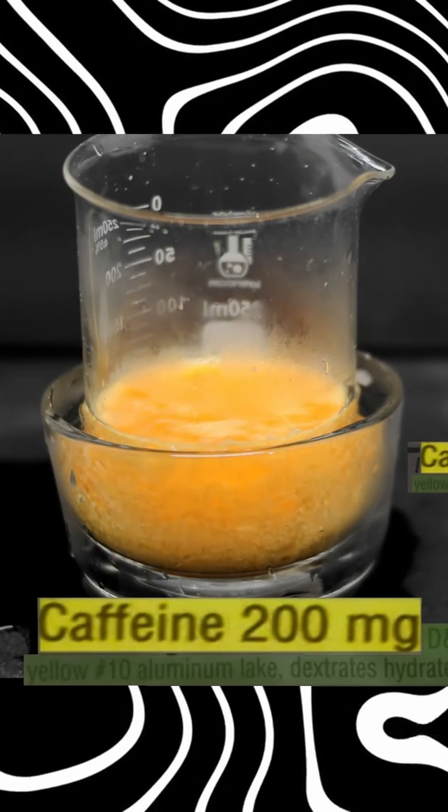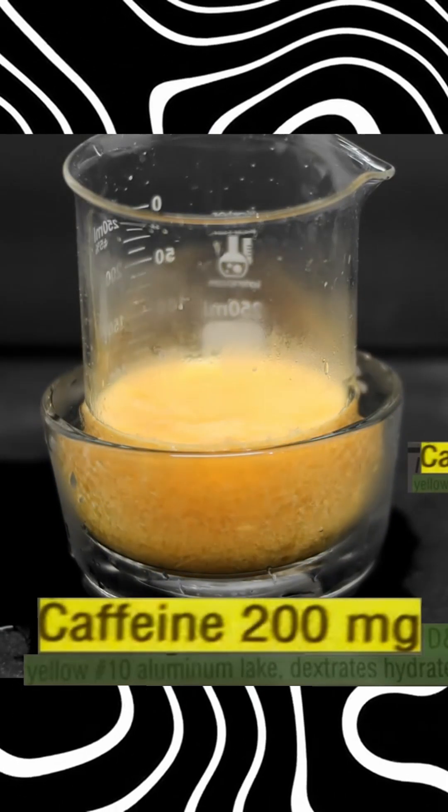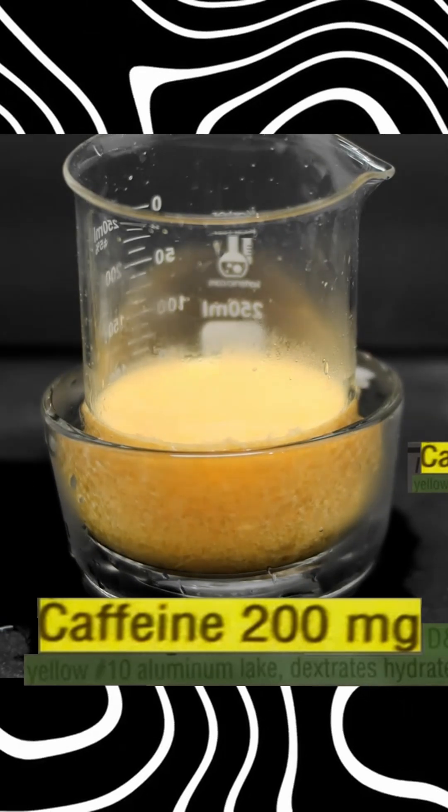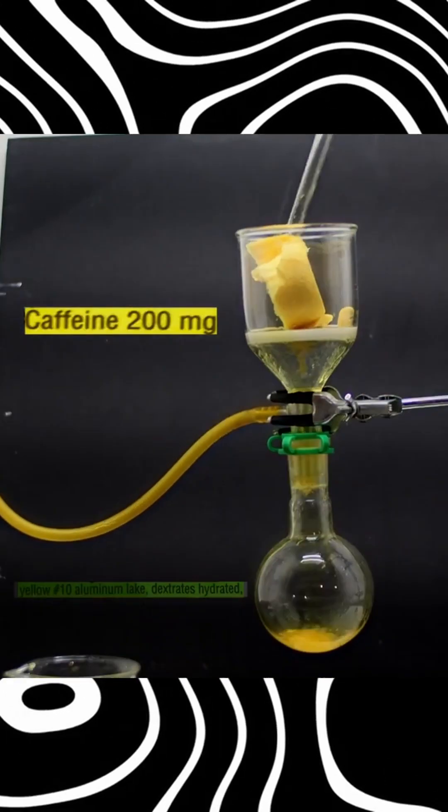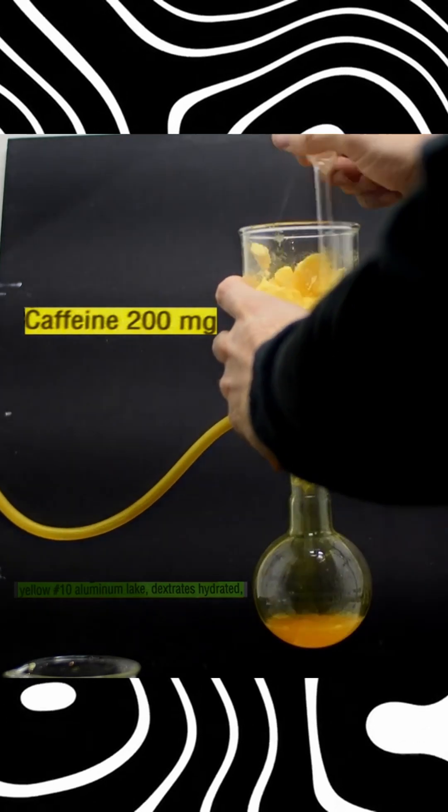Then if we cool it down, the water can't hold on to all the caffeine, so the caffeine starts to crystallize out. Then we can filter out the caffeine crystals from all the other stuff dissolved in the water.